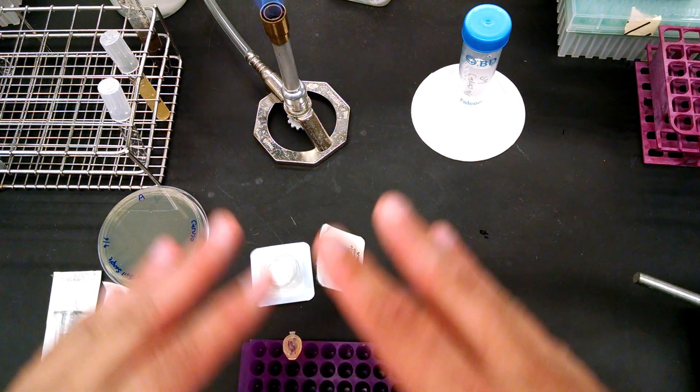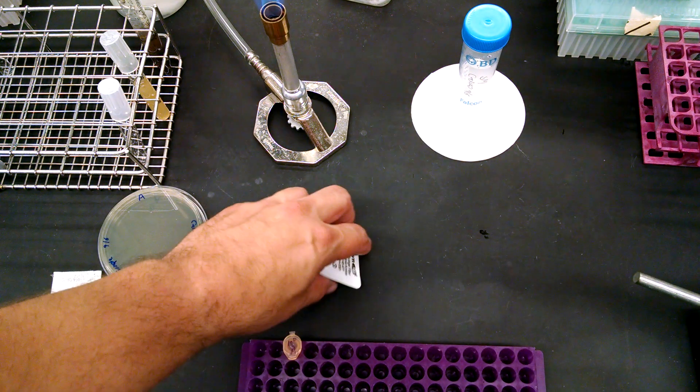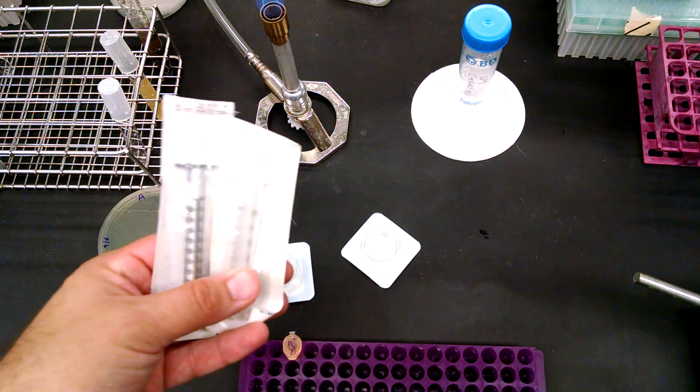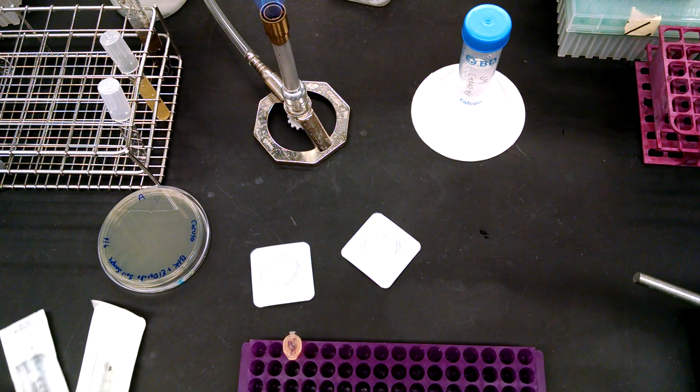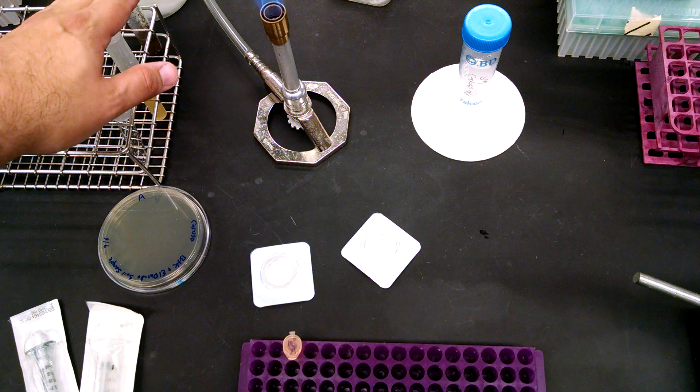You should have sterilized, of course, disinfected your area before you worked. We have some filters. We have some syringes. We have the samples that we're going to work with.